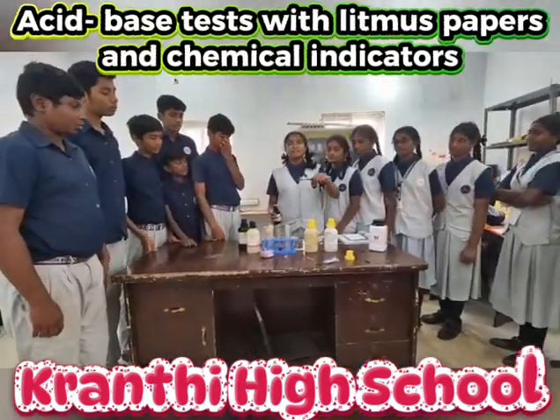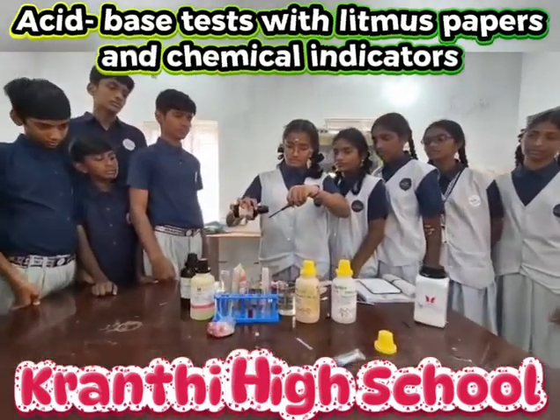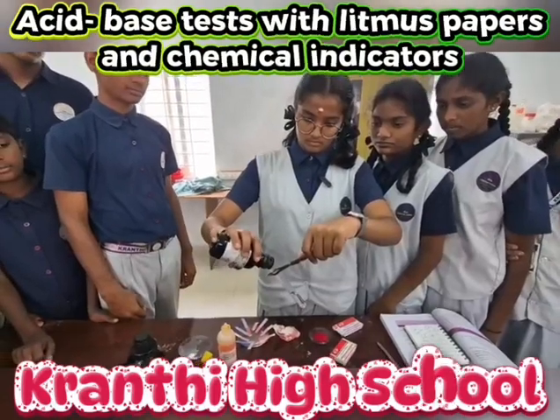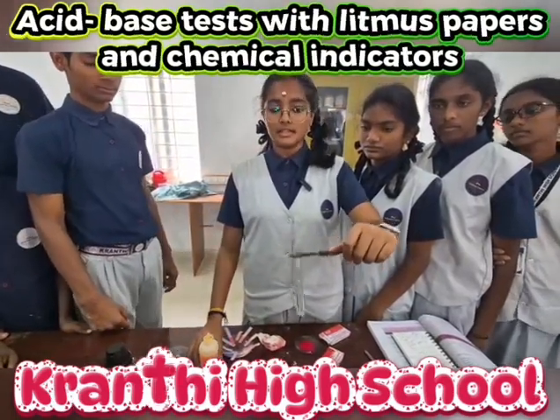Now we are testing nitric acid. Now we are adding phenolphthalein indicator to it. As you see, when we add phenolphthalein to it, it is colorless.